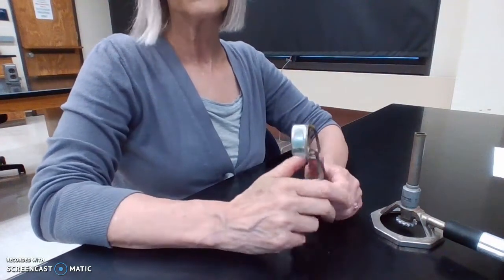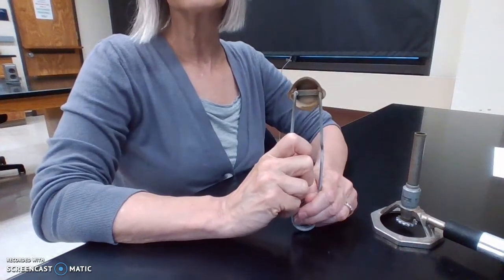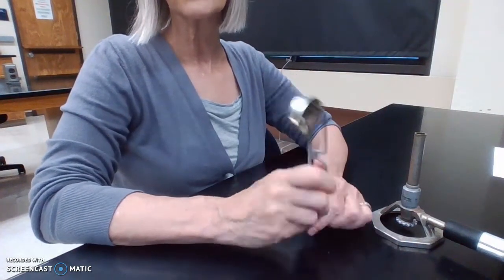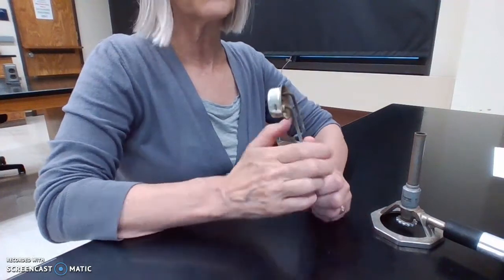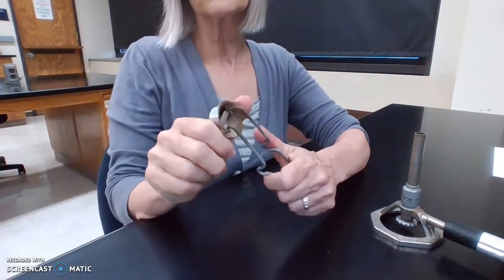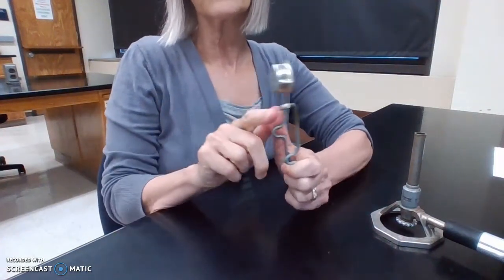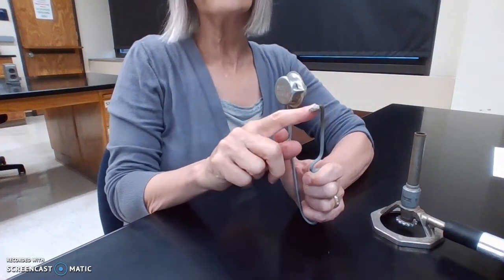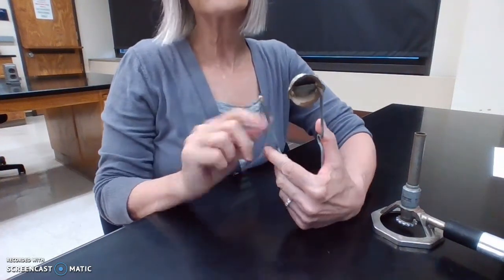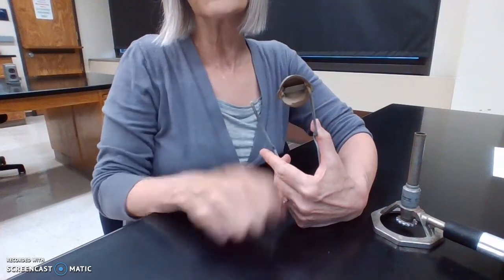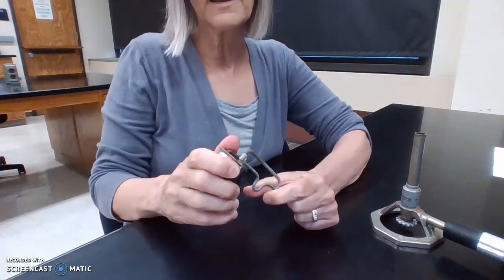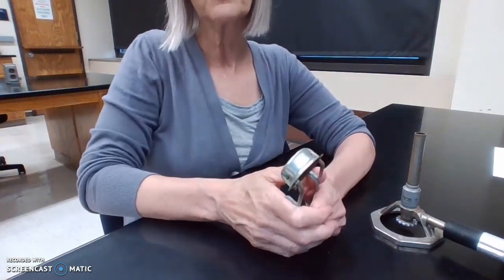You can use matches if you want, but I generally encourage people to use strikers. The problem with strikers is you've got to make it work. It's a little bit trickier than a match. What you'll notice with the striker is there's a flint, and the flint rubs against this little grate and makes a spark. You will not get a flame without a spark.